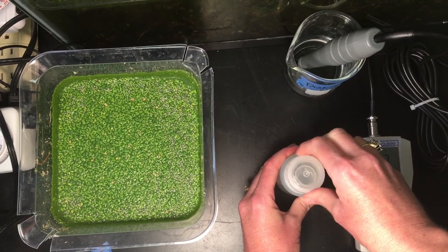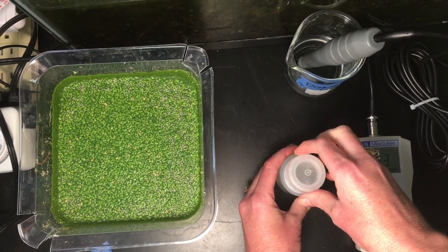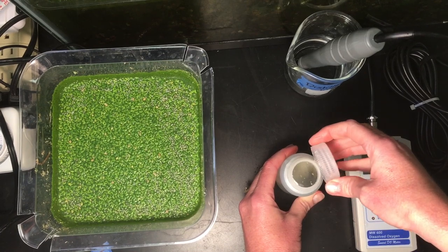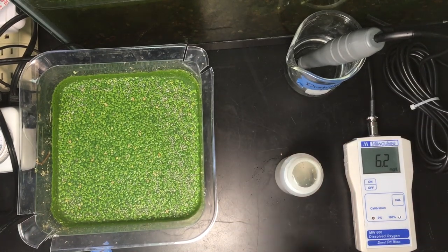Alright, so here I am carefully opening it. As soon as it opened, some oxygen got in, but that won't skew it too much.